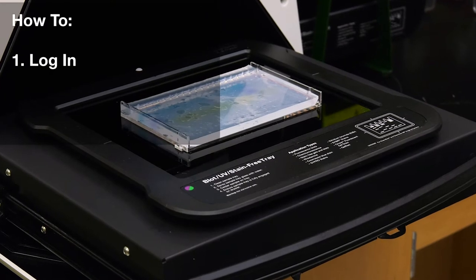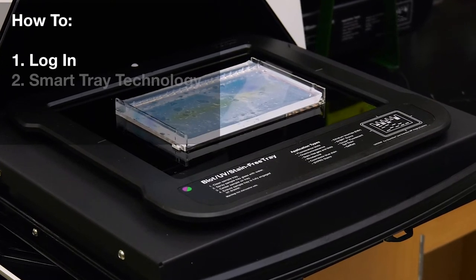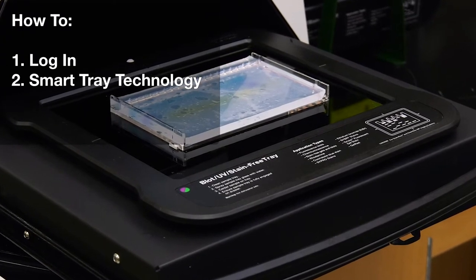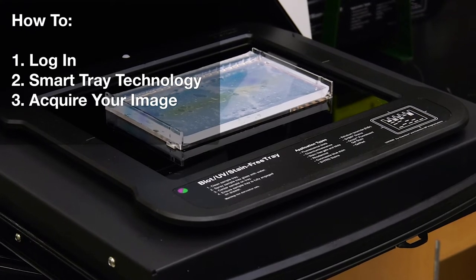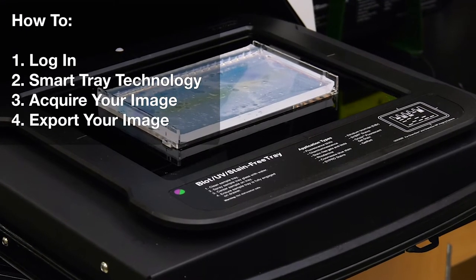In this video, you'll learn how to log in to your Chemidoc, use SmartTray technology, and acquire DNA gel images in three easy steps and export them.